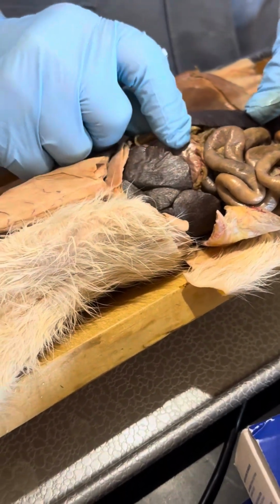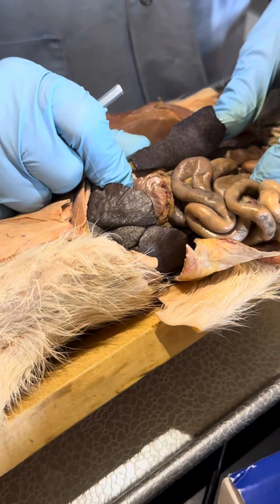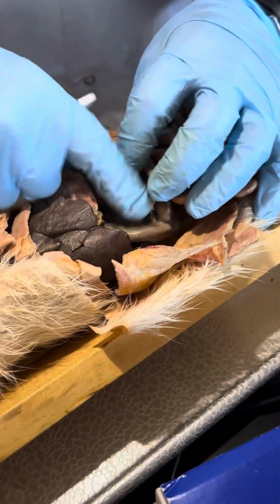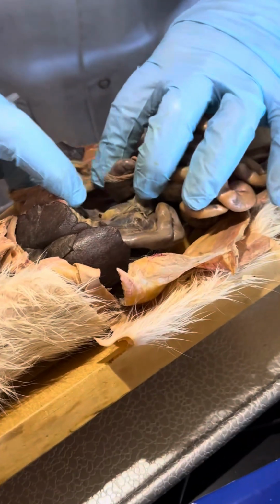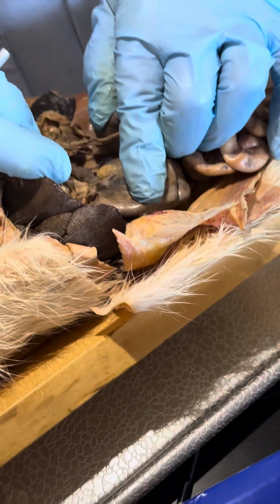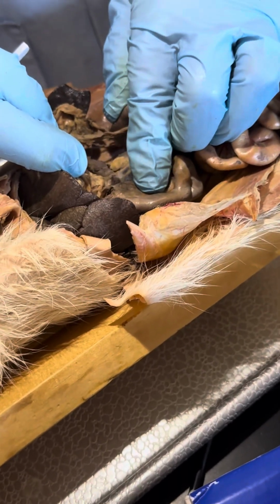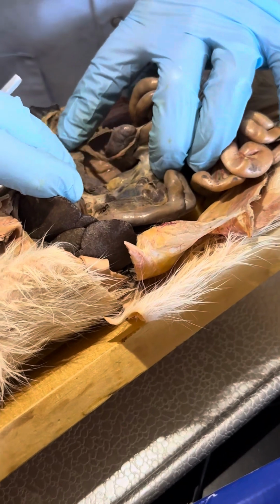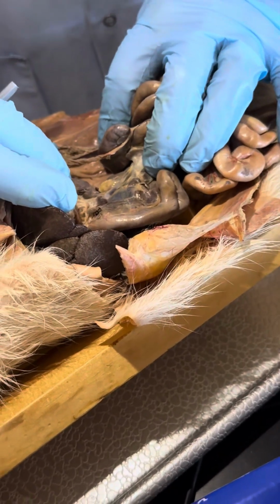Okay, now right here, this thing that looks like a pancake, what's that? Spleen. That's a spleen, okay? And then we have a different arrangement in the cat than we have in humans. We have something that looks like an upside down L, it kind of resembles hamburger helper. It goes up here and then it comes transversely across right here. What would that be? Pancreas, right?